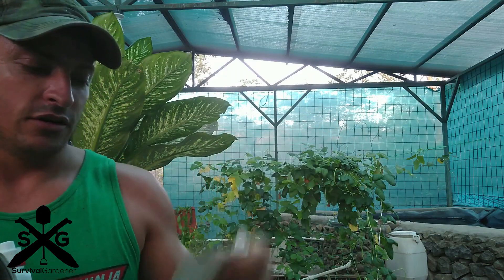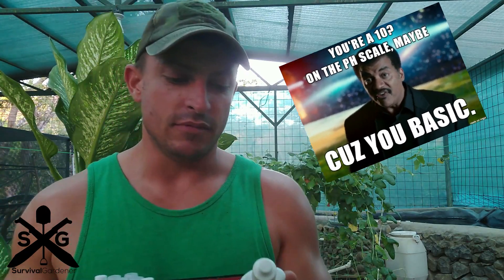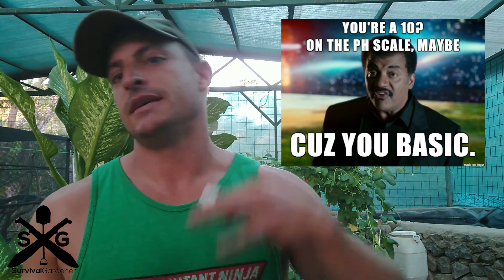This is the color chart you can match your test tubes to. I'll go over what this thing tests. It does pH — regular range pH and high range pH. So if you have a super basic system, maybe a bunch of calcium in or something like that, it'll be able to test higher, like up at eight and past.